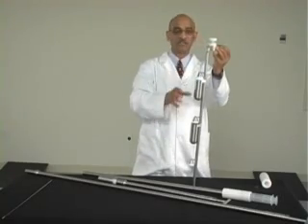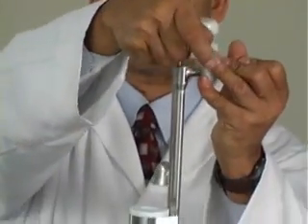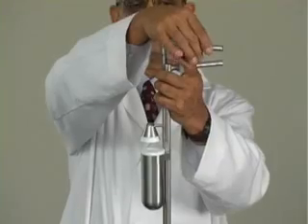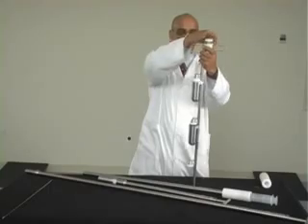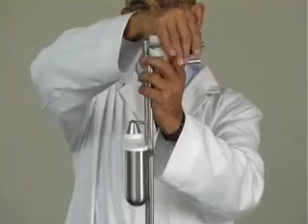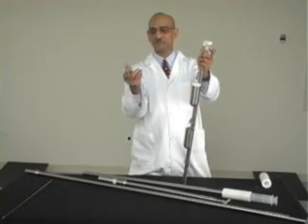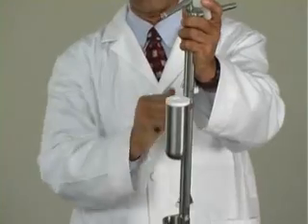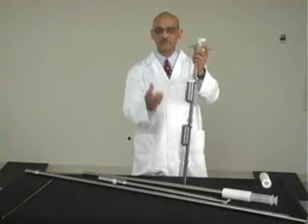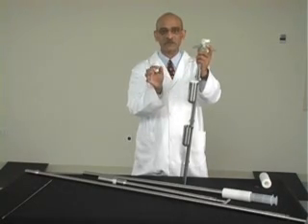Once you reach the location for sampling, you just lift this up, move to the side, and let the material flow into the bottle. Then you just close this and push it down — it seals. Then you take the sampler out, open it, take the bottle out, and remove the bottle from the adapter. The advantage with this is you can take multiple samples directly into your own bottle, and the bottles don't get contaminated.